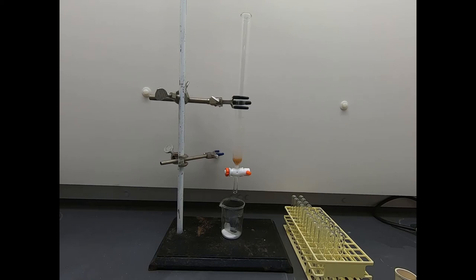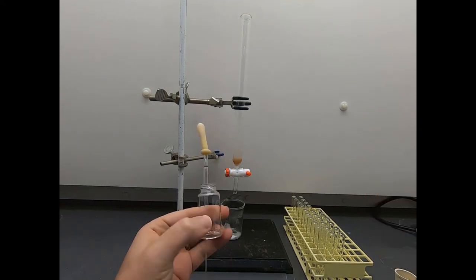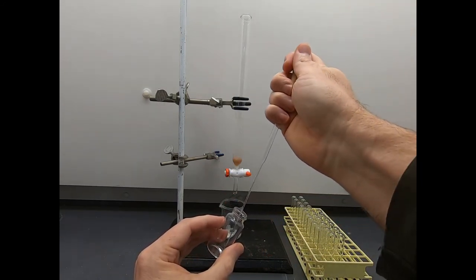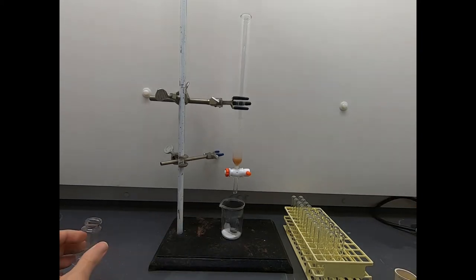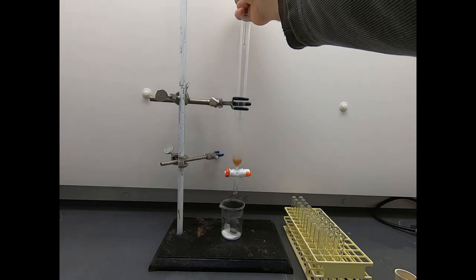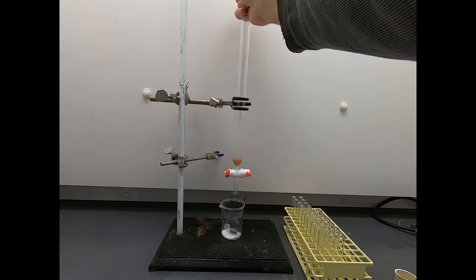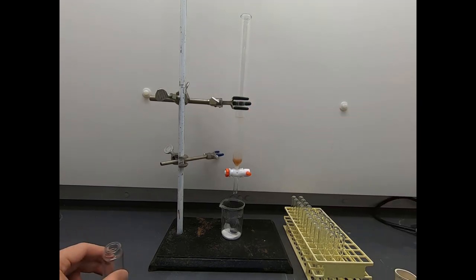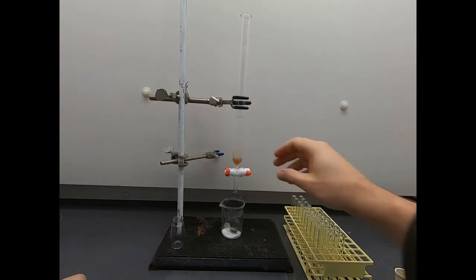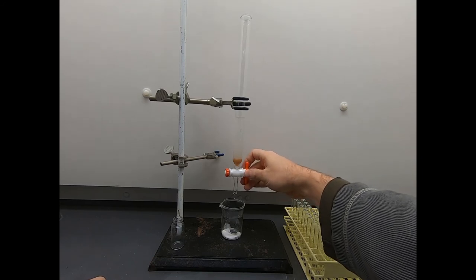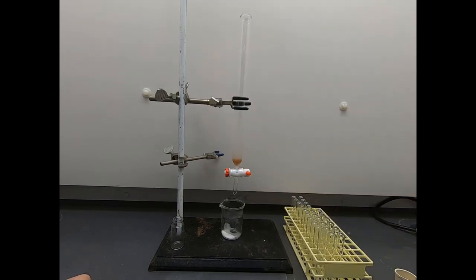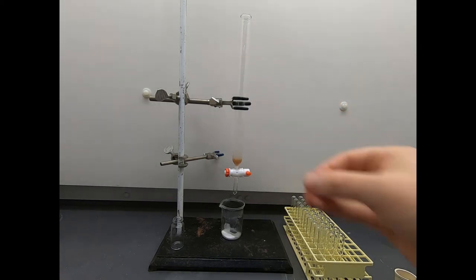The volume of that mixture that I put on there is going to displace some of the hexane and push some hexane out the bottom. Now I'm going to rinse this flask out with a little bit of solvent. Fortunately, my material is soluble in hexane, both materials. And now we'll drip this rinse. The key thing is we want to use as little solvent as possible. That way, all of our material is in this tight band on the column. Let's let that drip through. Now there is no standing liquid up here. The column is now loaded, and we're ready to go by putting mobile phase through here.